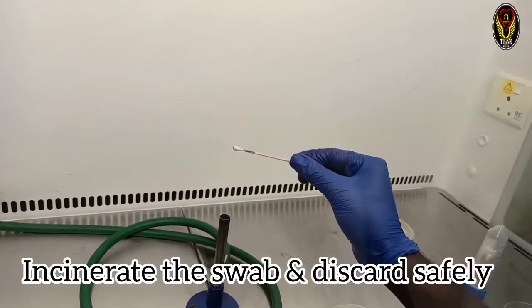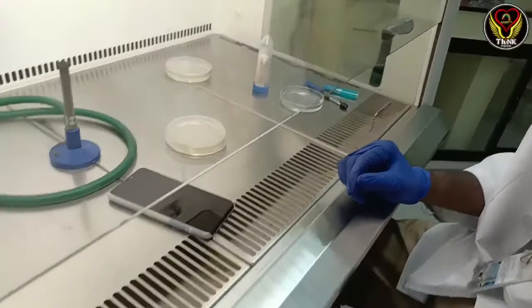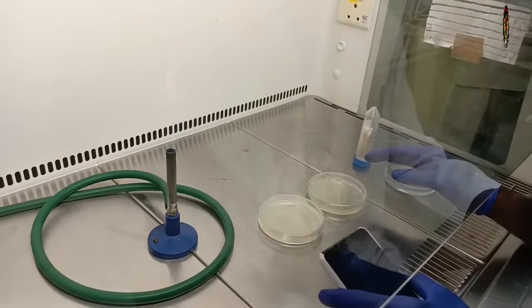We will sterilize the swab and discard it carefully. We will then place the plate aside.